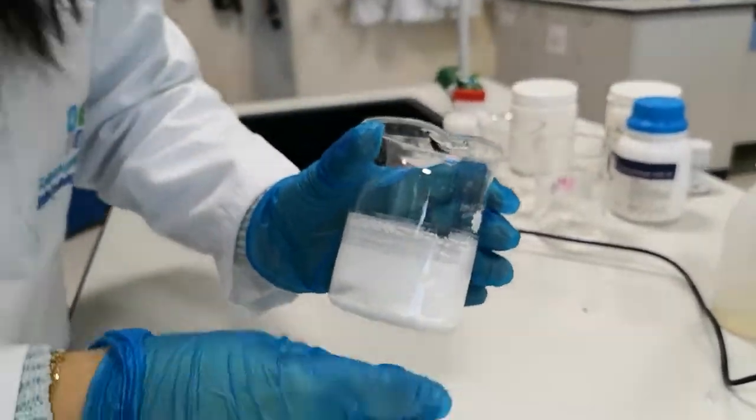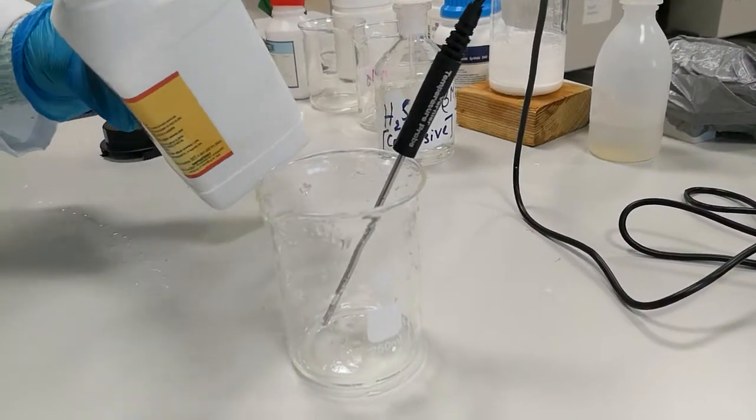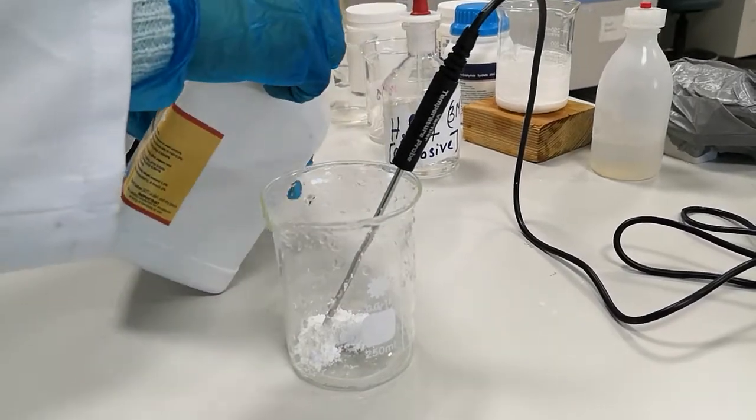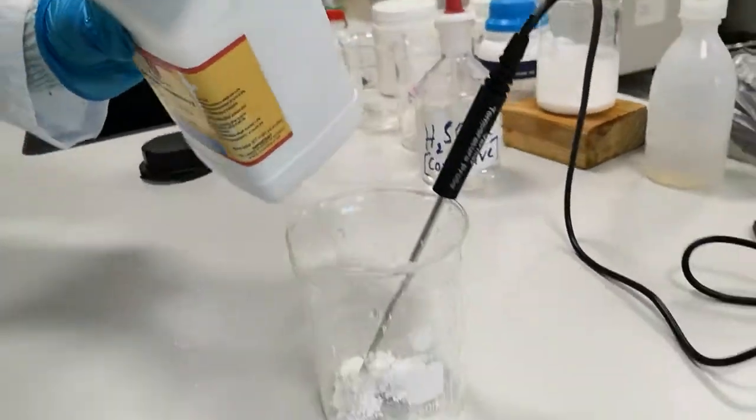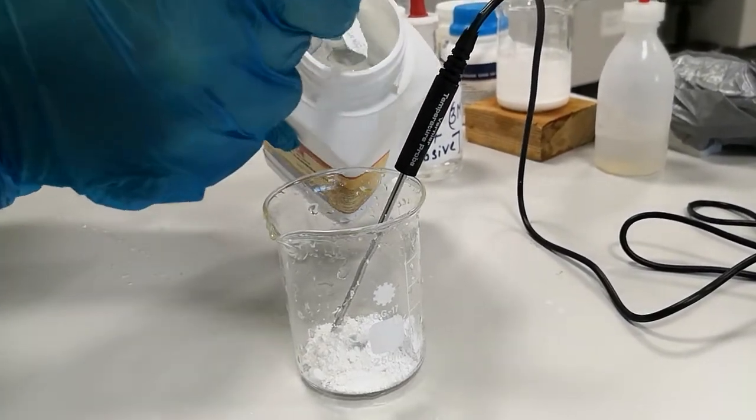Now the second experiment is to show an exothermic chemical reaction. I have here calcium carbonate and I'm going to add concentrated sulfuric acid to it.